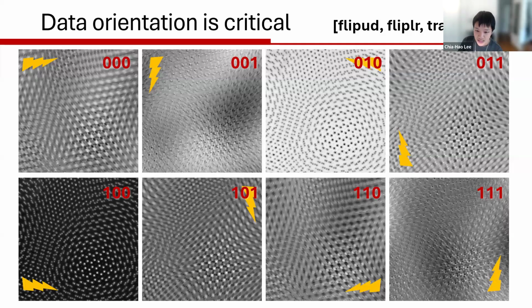And even after you acquire the data, when you load your data with different packages or different libraries, or just display them with different software, you actually see a different diffraction pattern orientation, which is extremely confusing. And when you run Ptycho reconstruction with the incorrect orientation of your diffraction pattern, you're actually going to see a lot of interesting stuff. First of all, these errors can sometimes be very subtle.